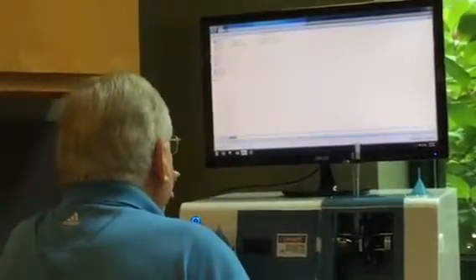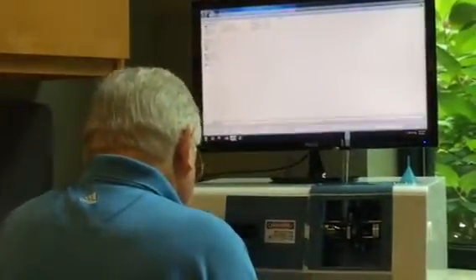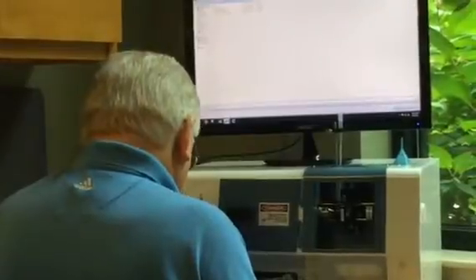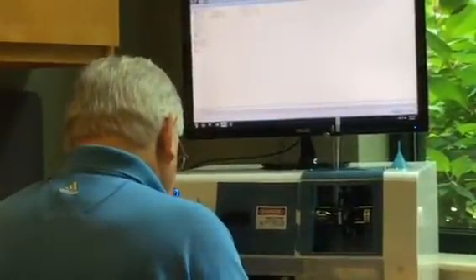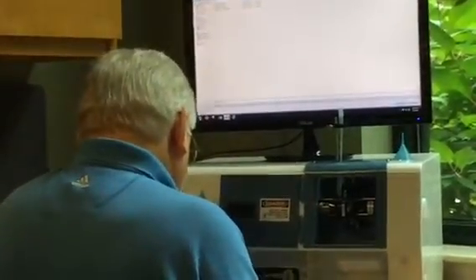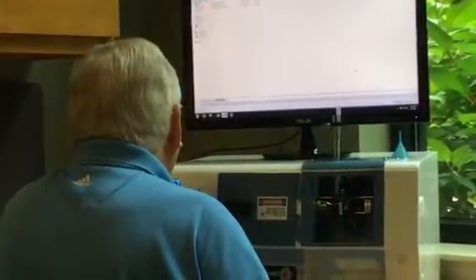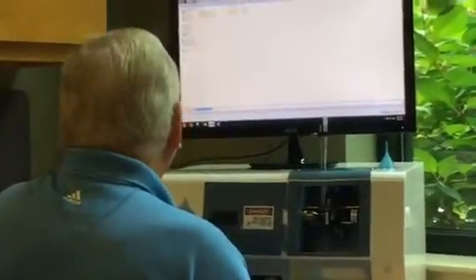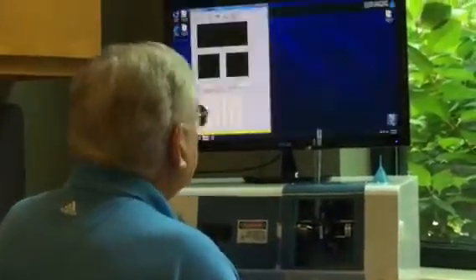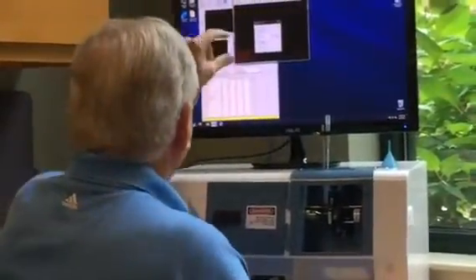Right. So what I do is go and name this, which is our 1608 today. And it is going to be at 10:05. With HTB 1, just for the heck of it, 50. Great, so you have that name. Save that, copy it, then cancel. Yep. And then I'll go over here to set focus, good, and that shows me that pump thing.